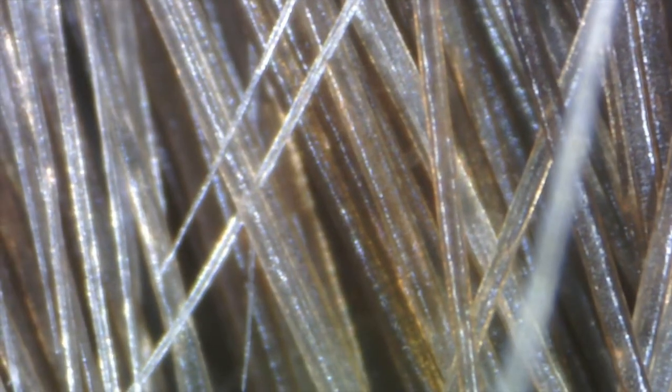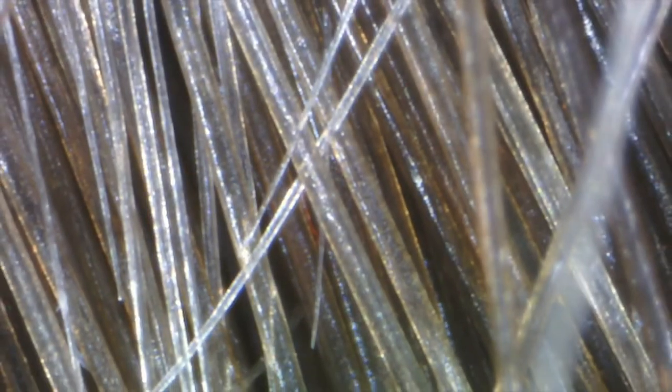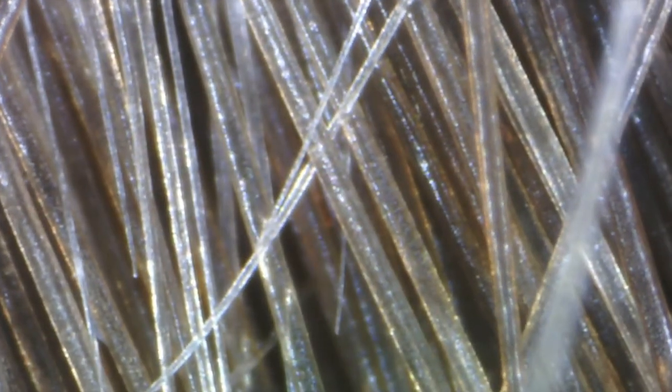So next I'm going to hold this up to my hair. So here's my hair. Whoa, and I can see individual strands, and it also looks like I got some gray ones, unfortunately, I hate to admit. Got some gray hairs going on there. It's normal for hair to vary in color, but a couple of those are definitely lighter in color.